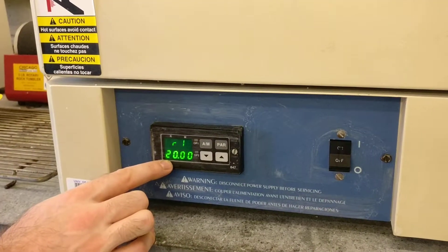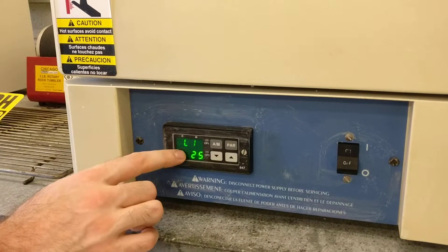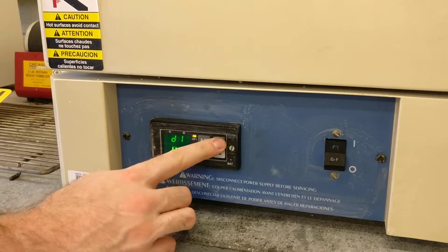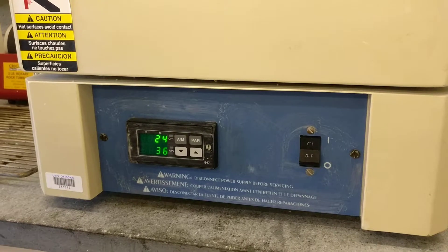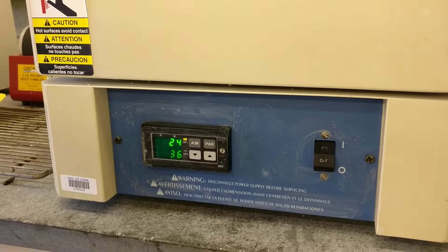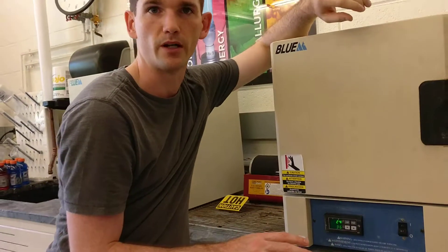This R1 is a ramp rate, so that's 20 degrees C per minute. This L1 is a set point level — this is room temperature. This D1 is a duration. You have to look through the manual, but I believe it's the time that you dwell at that temperature. So if you want to heat treat for an hour, you just set it for 60 minutes.